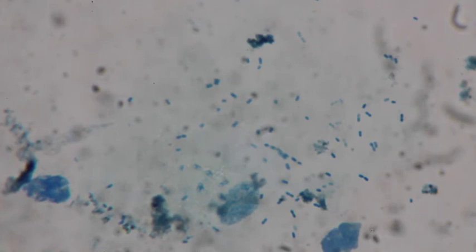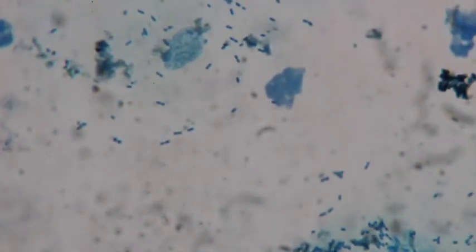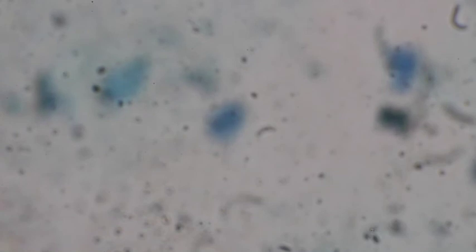So the bigger blue dots are the nuclei. We can see 1, 2, 3 nuclei in this image. So there are 3 cheek cells kind of on top of each other. Then you can see all those nice little blue dots. Those are the bacteria in the sample. So a lot of bacteria on these cheek cells. And you can see the, oh man, my bad. So we can see all this tissue. So I gouged my tissue really well.